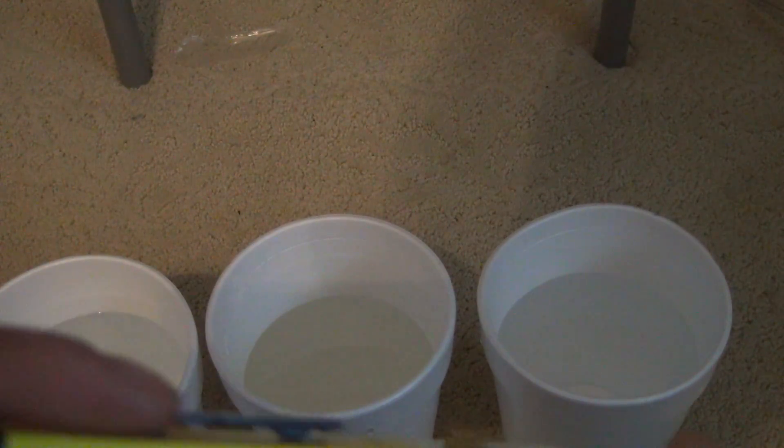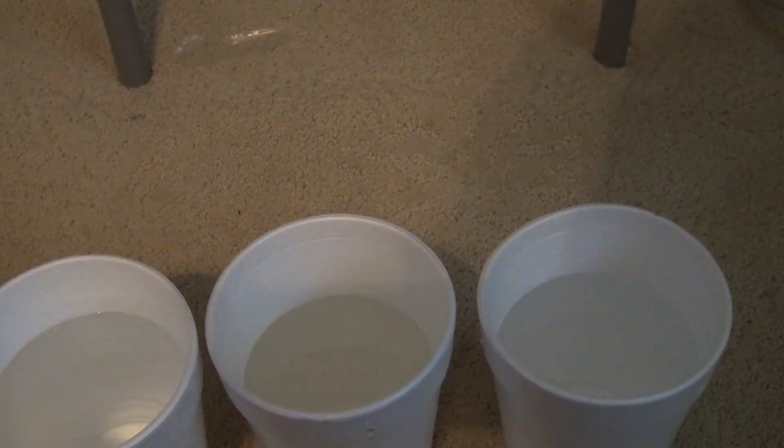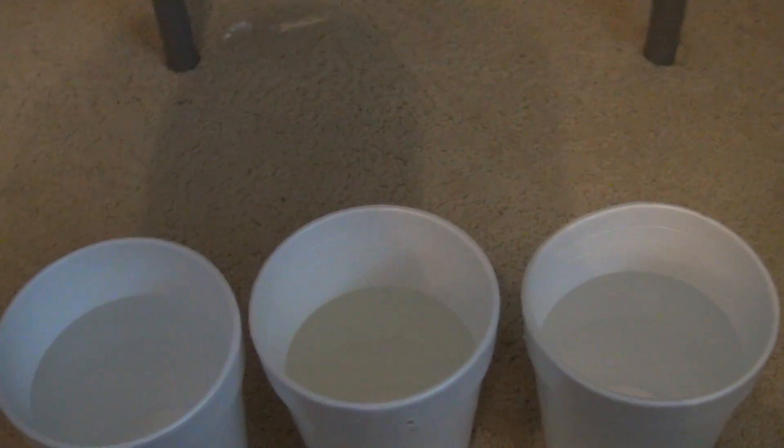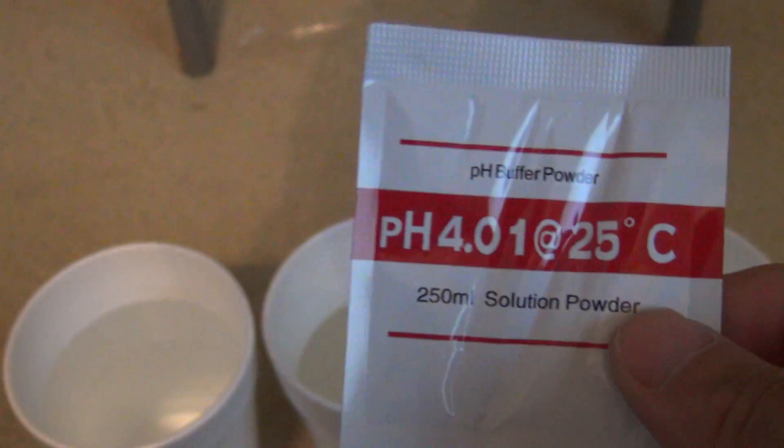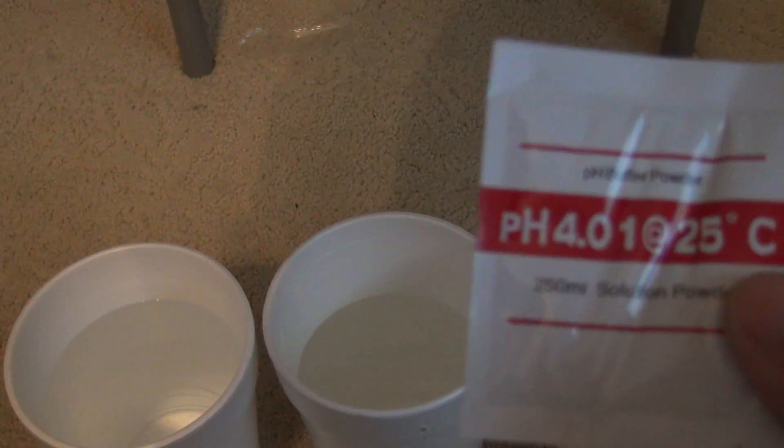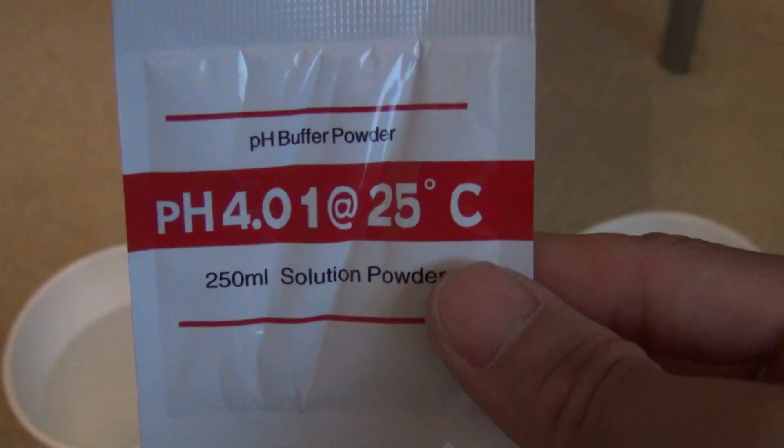As you can see, it's not calibrated yet. So what you want to do when you get this product, you use the solution powder, pour it into filtered water, and you can use it to calibrate it.